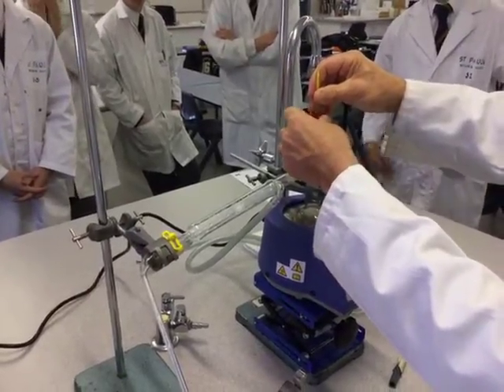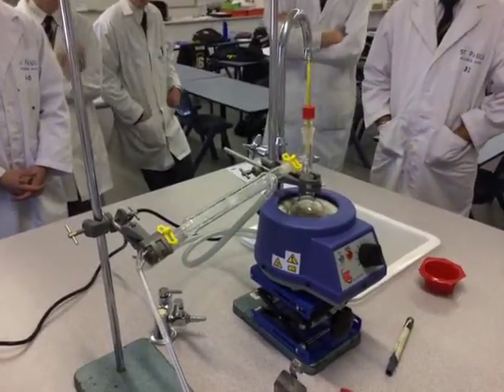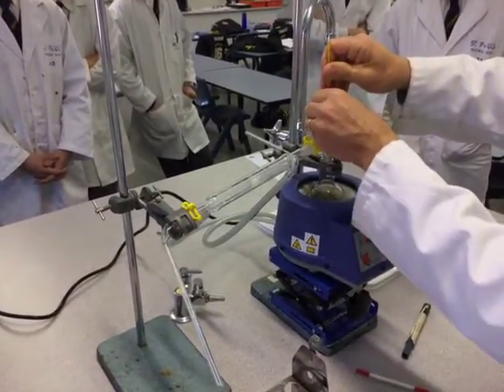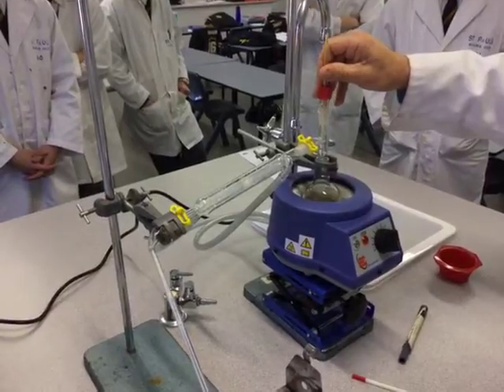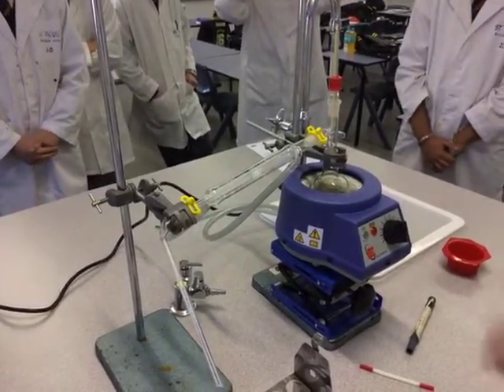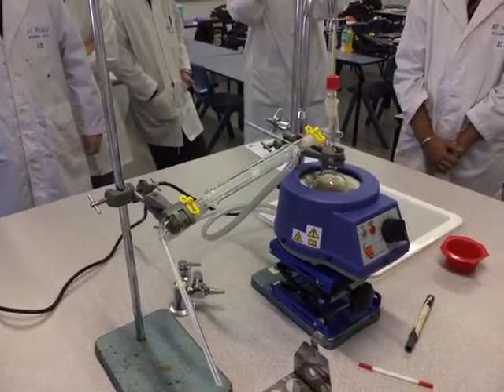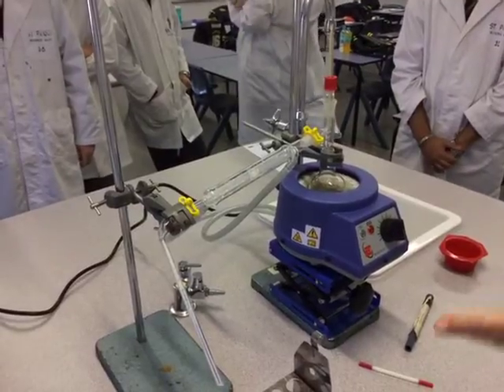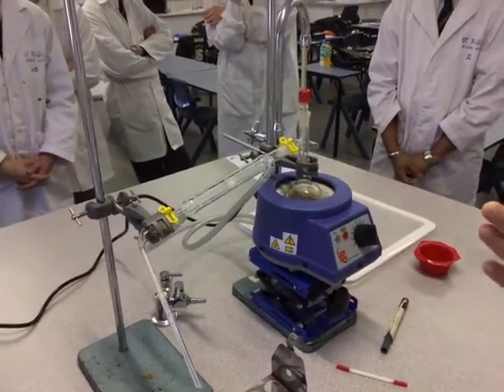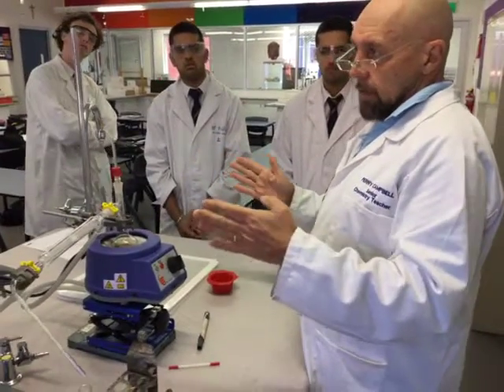The thing you'll find difficult is being able to really see the temperature as clearly as possible — from this angle more or less, that's fine. What temperature are we going to collect the fractions at? The ester has a boiling point of 126, so where are you going to start collecting? Maybe 120, depending on how pure — you might start at about 122 to 124, you might go to 128, maybe to 140. That's the range you're going to collect your ester at.